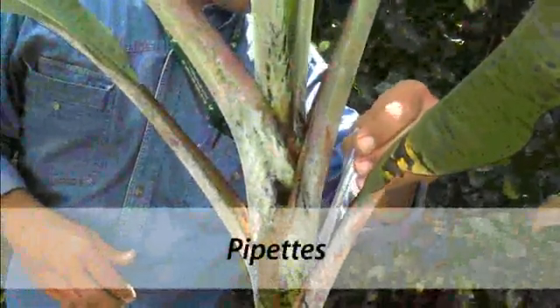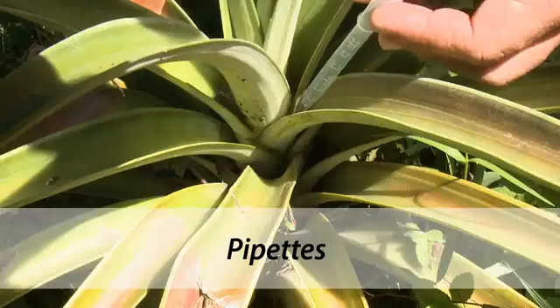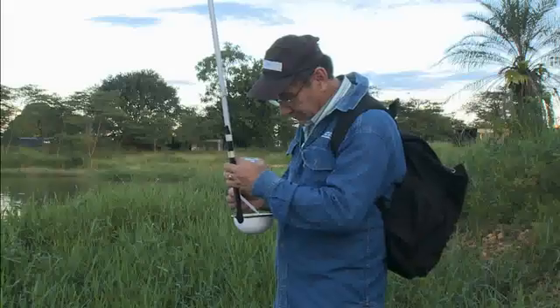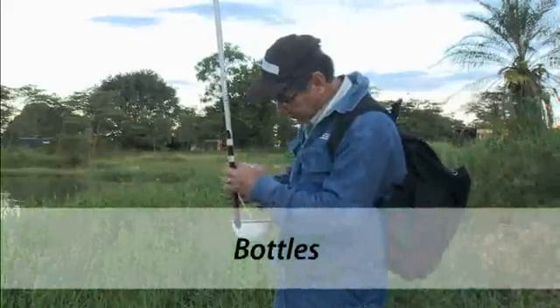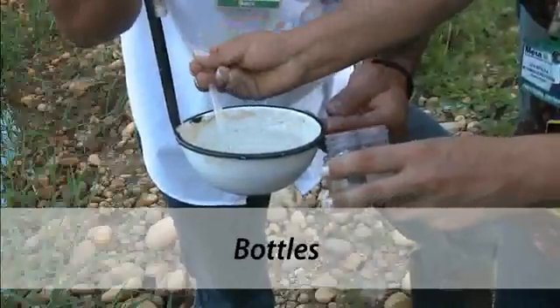Pipettes are used to select out larvae from the dipper and transfer them to a storage container, but can also be used to collect larvae from the surface of smaller breeding places. Bottles or other forms of large containers are needed to store collected larvae. Typically, one bottle is designated for each breeding site sampled.